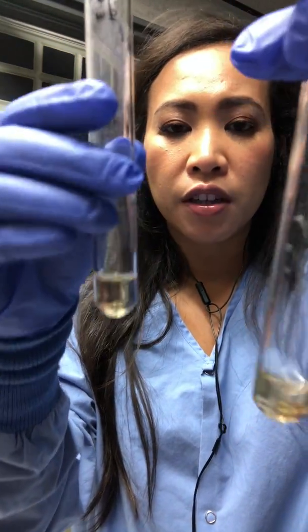Okay, so the purpose of that Reagent B is also for fermentation. And the word that we're looking for is the acetoin, which turns red in the presence of Barritt's reagent, indicating a positive result of the butanediol fermentation. So I'm sorry, this test is negative because you don't see any reddish tint on this one clearly. These are all clear with the naked eye.